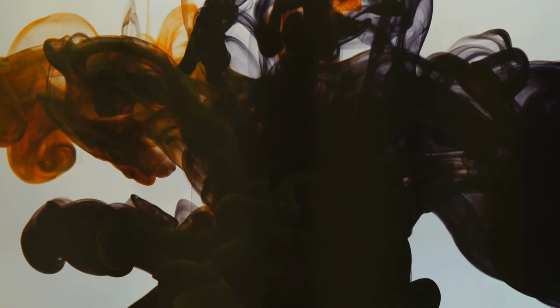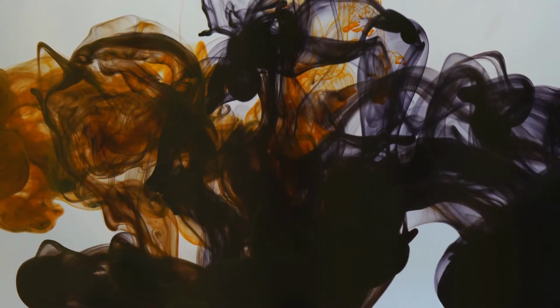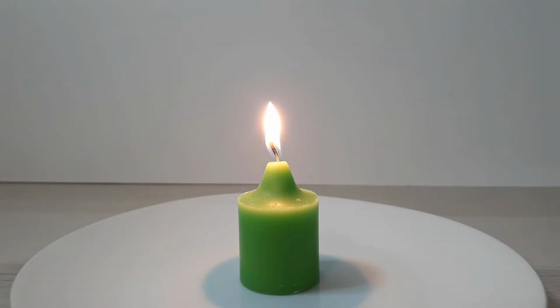Lamp black, or carbon black, is a material which is produced via incomplete combustion which deposits onto surfaces in proximity to a flame, similar to soot. Due to its intense color, or lack thereof, lamp black has been used for thousands of years as a pigment for inks and paints, and continues to serve this purpose to this day, used in printer toners, polymer pigment, paints, etc. The creation of lamp black follows a very simple procedure.